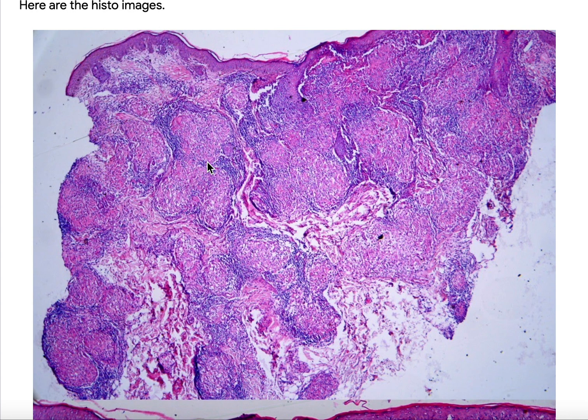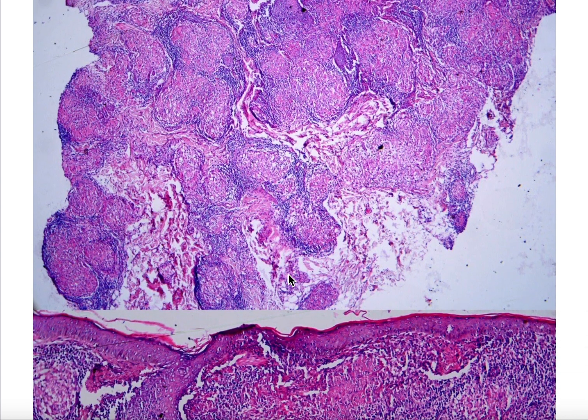All right. So essentially, just to summarize, these are sarcoidal granulomas on low power, naked granulomas with a thin rim of lymphocytes coalescing together. They follow neurovascular bundles in places. You may even see perineural infiltration in sarcoidosis. That does not necessarily mean it is tuberculoid Hansen's.